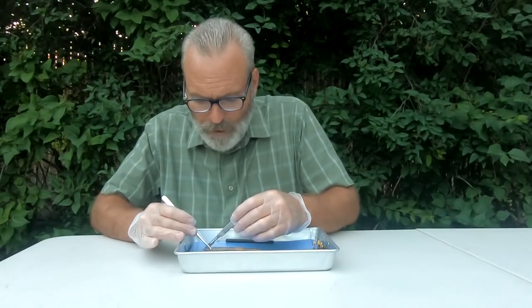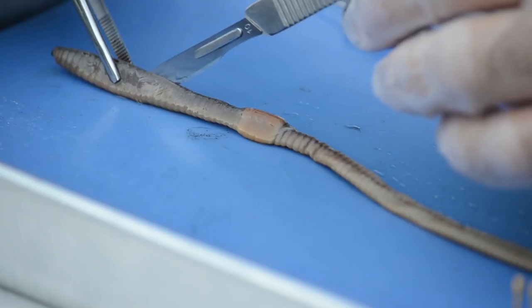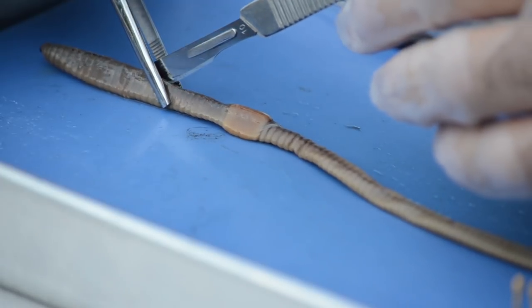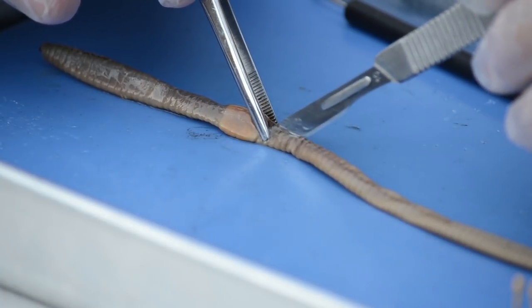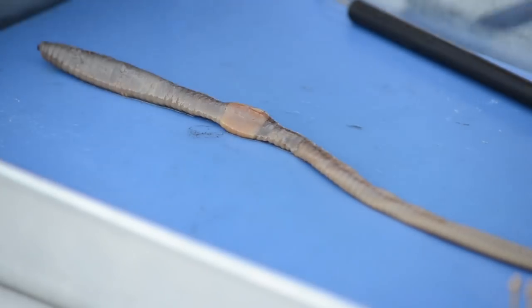I'm just going from the anterior to posterior. Try not to go too deep. And if you cut the intestine or the crop or the gizzard, we'll do our best with whatever we have. Just try to be very careful when you're doing that part.